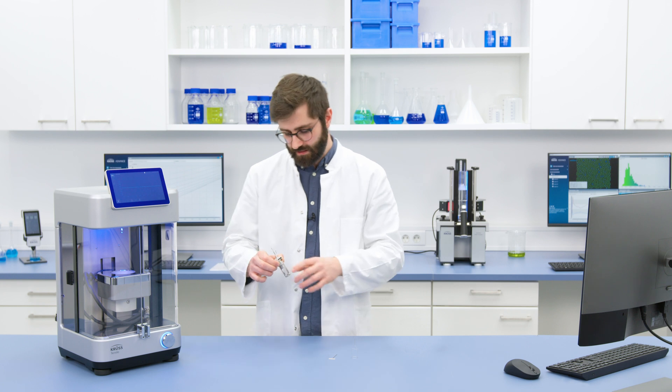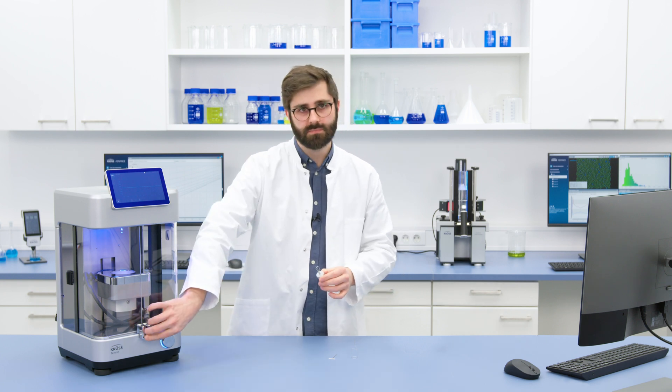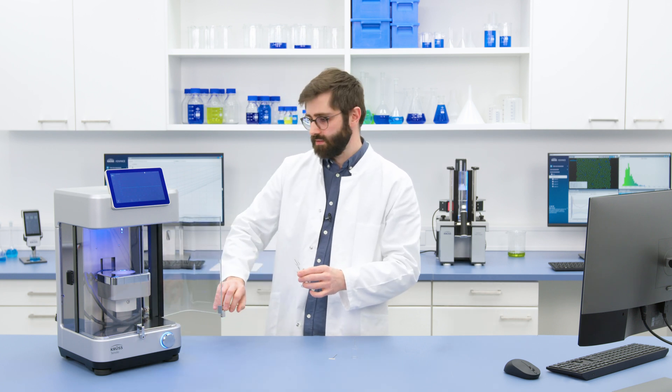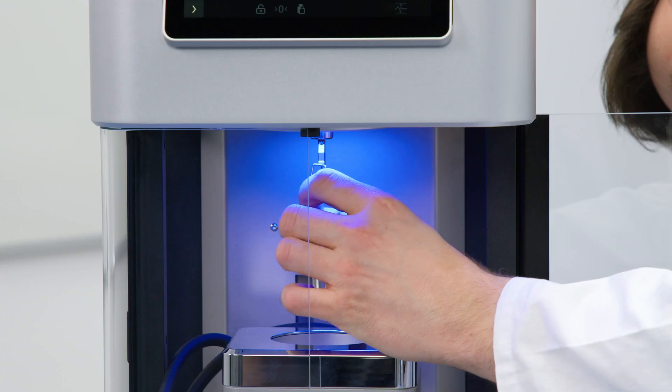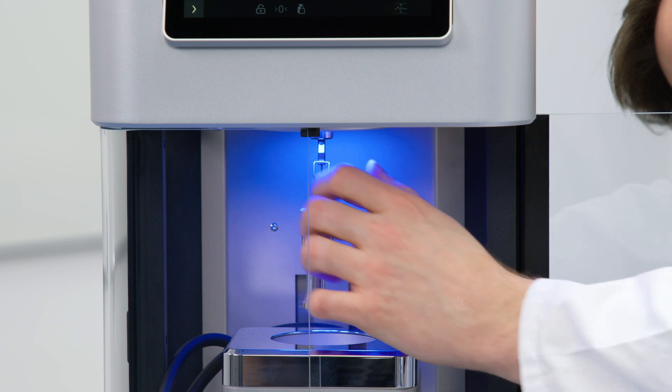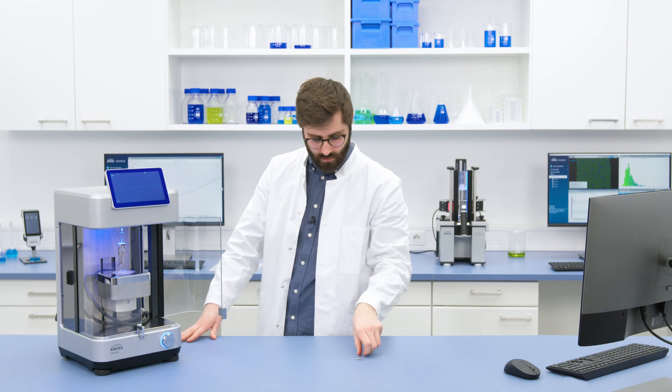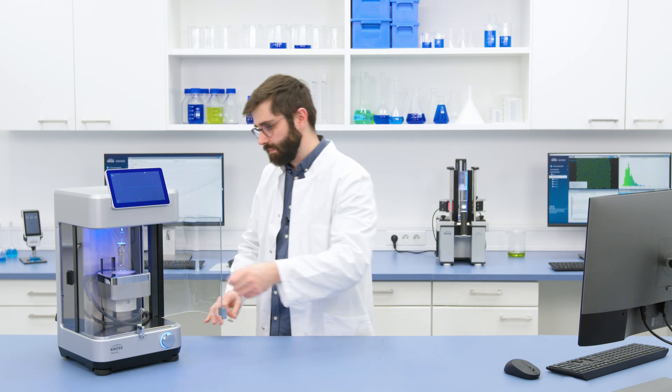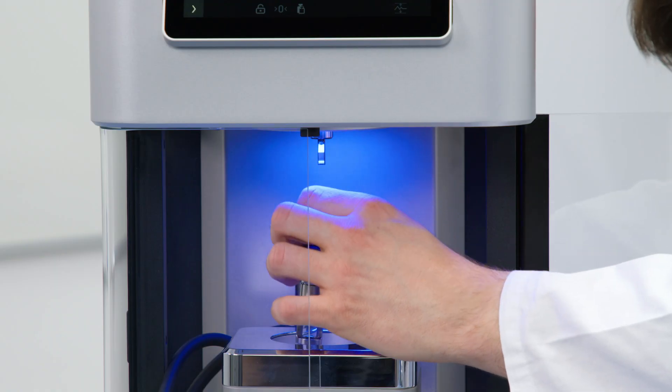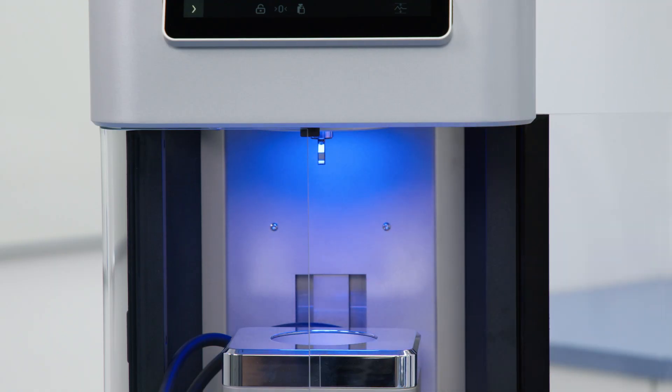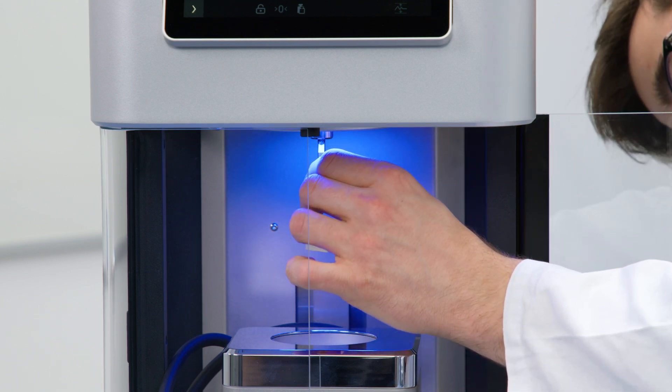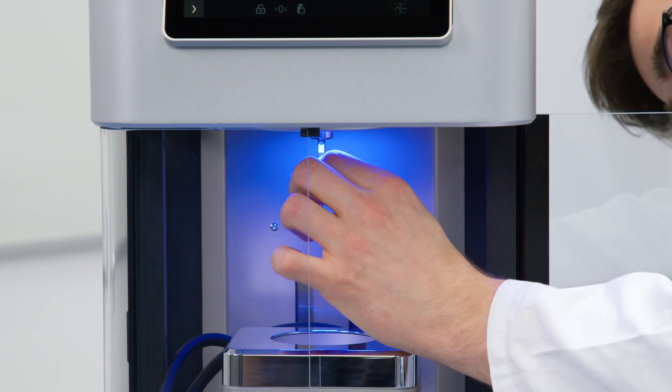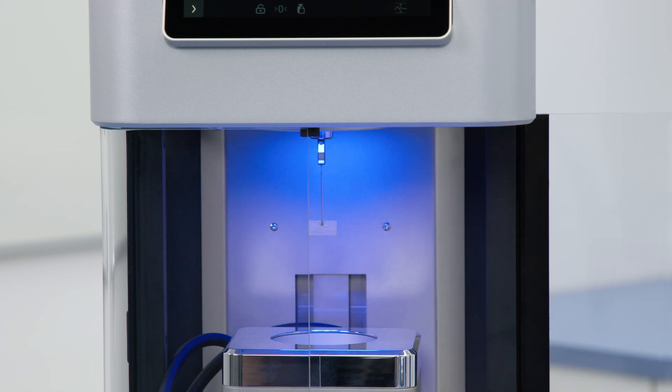And if we want to put these into the device, it's pretty simple. Just open the door, or I can switch this back. Now I'm ready to measure surface tension of my resin or my ink or my paint.